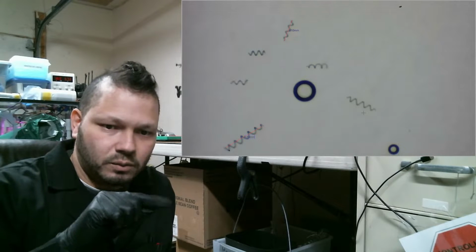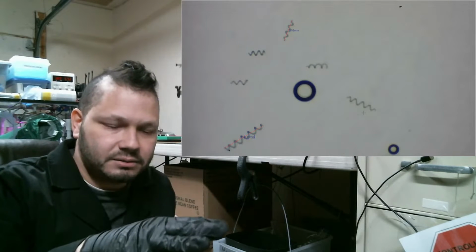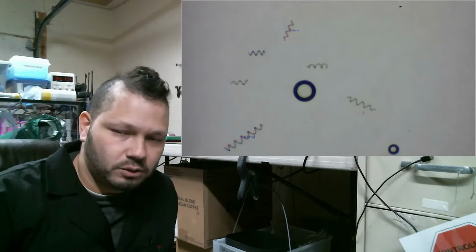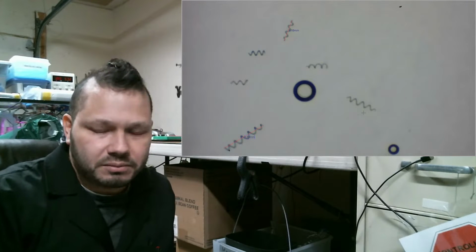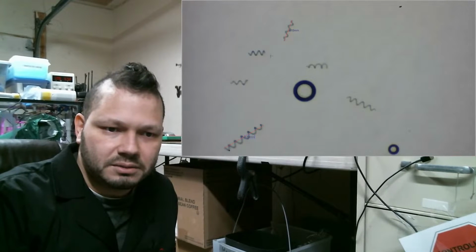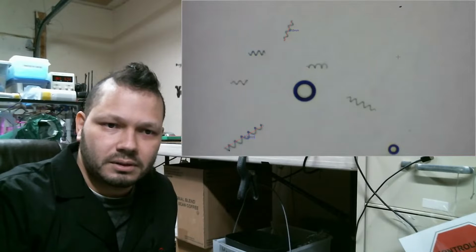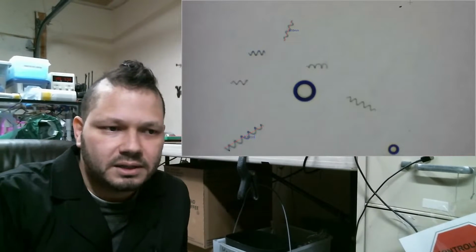So once I do the measurement on one picture, it appends it to that spreadsheet, and I go to the next picture and I keep going, and I have a whole database of measurements that I can then play around with, however I need to. But rather than having to store all these, I can just make those measurements and then put them into a spreadsheet and then figure out what to do with them from there.